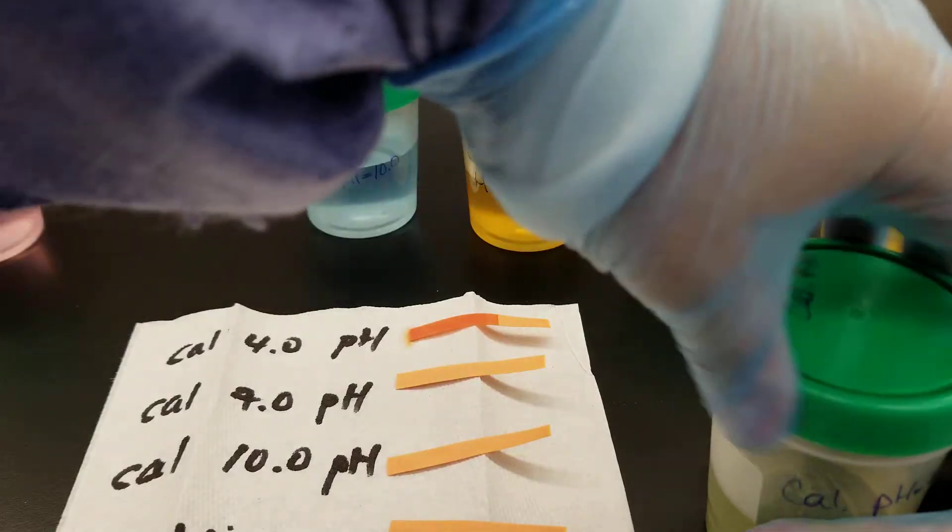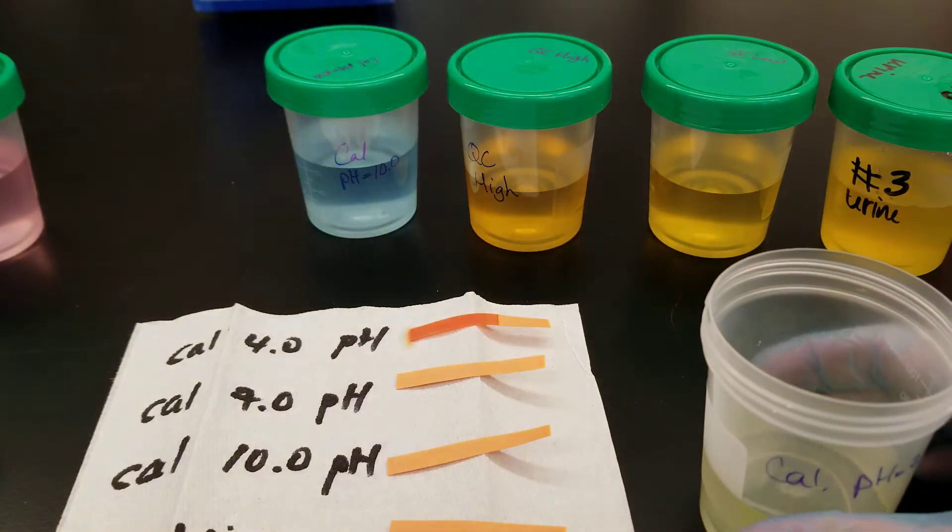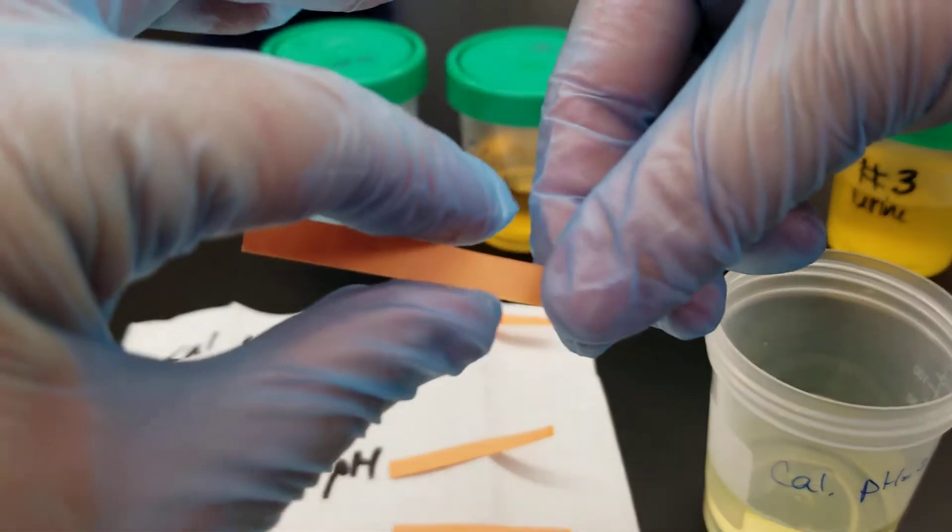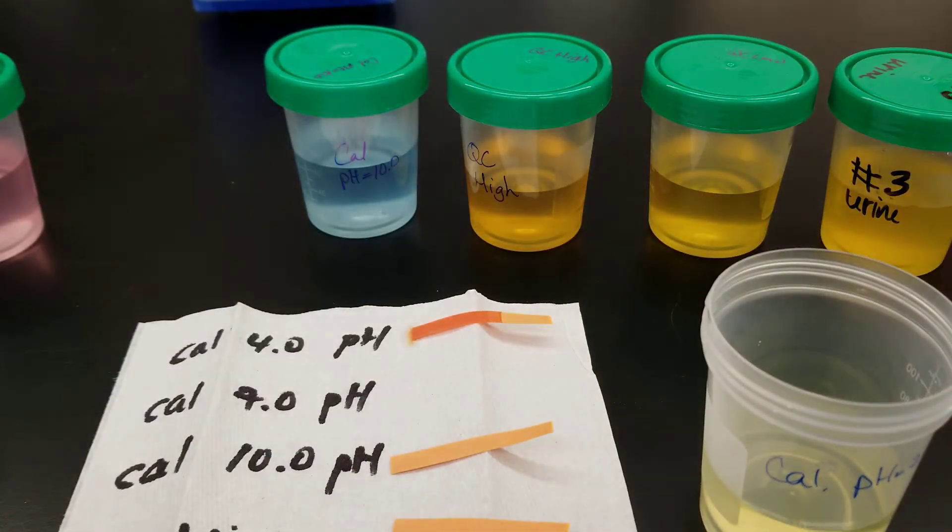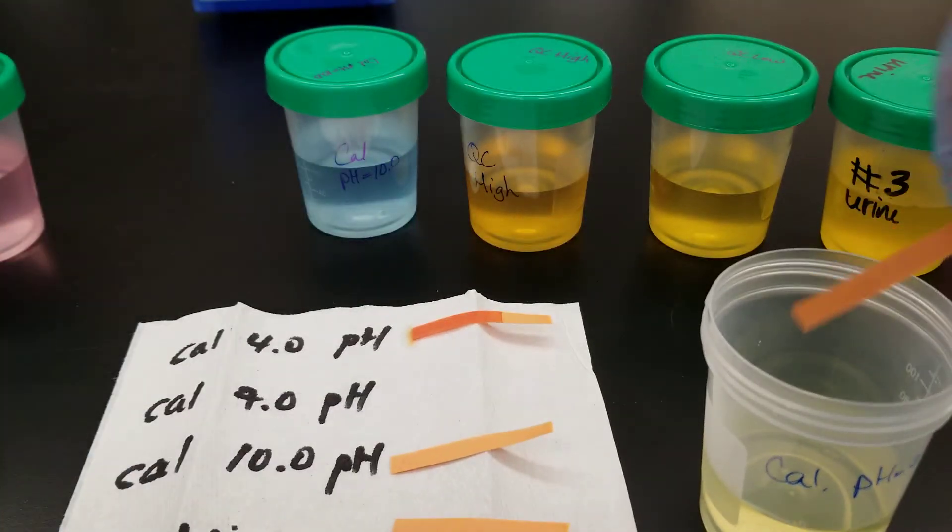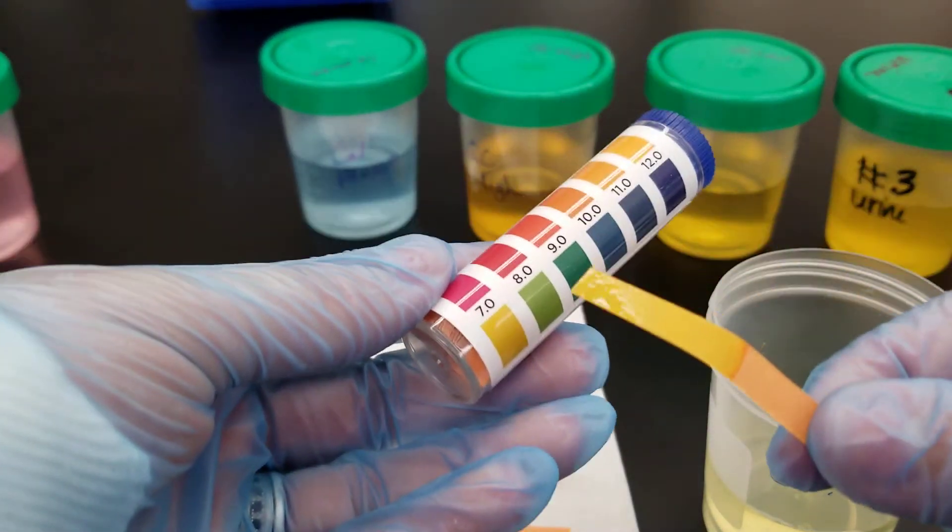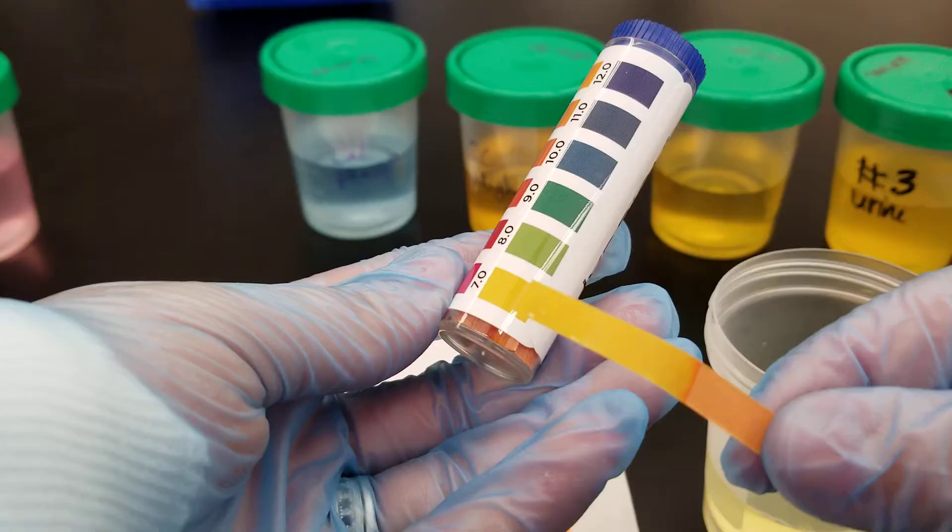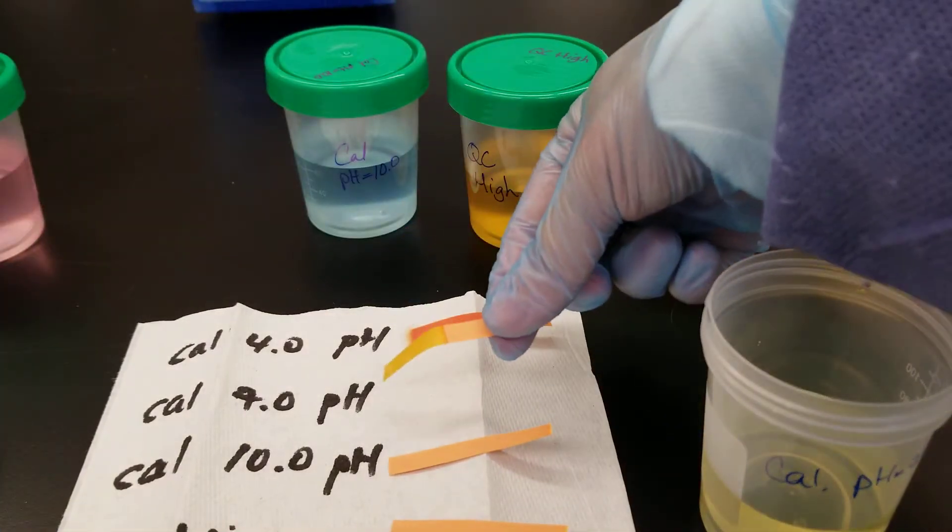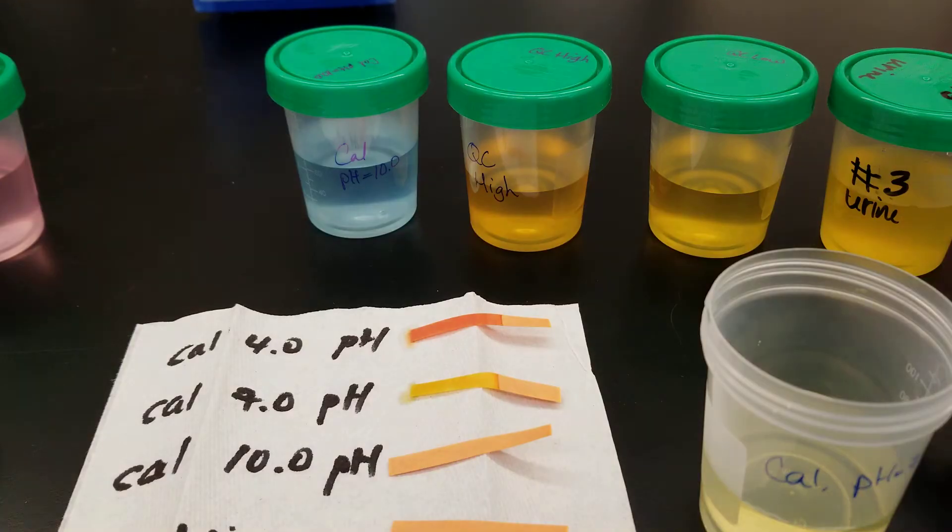Women naturally do have the ability to see more colors than men do. If you couldn't tell the difference between those, then that is where that biasness does come in. So we just did the 7. Does it match the 7? Why yes it does. Look at that. This is turning out really great here.